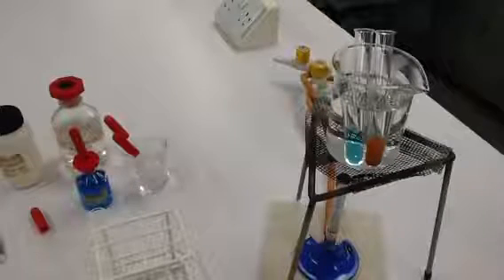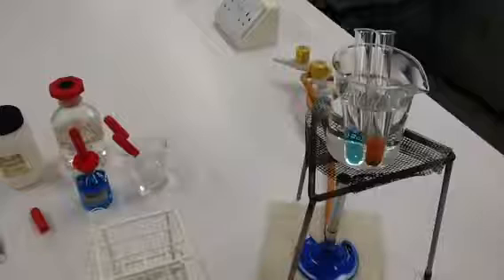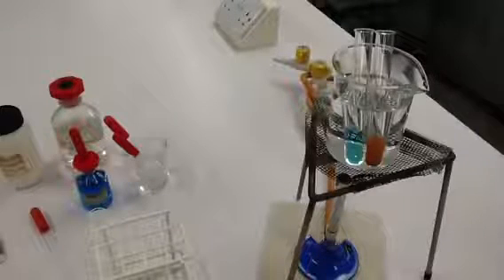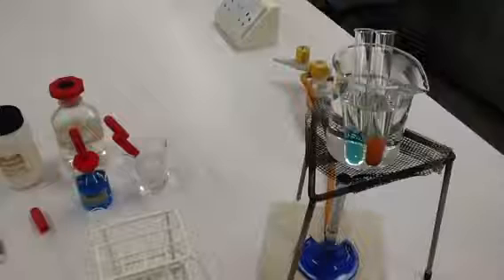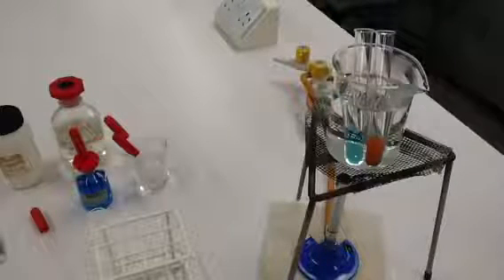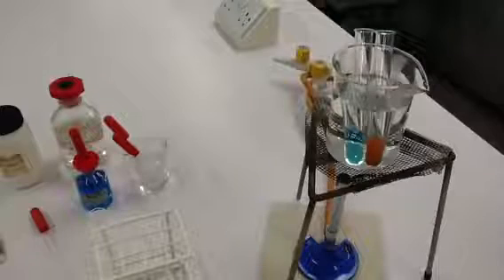When testing for non-reducing sugar, you always need to make sure that you carry out the reducing sugar test first so that you can eliminate whether or not the sample is actually a reducing sugar. You wouldn't know if you did the non-reducing sugar test first.